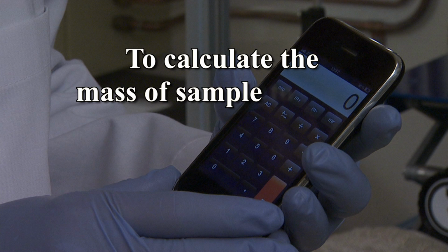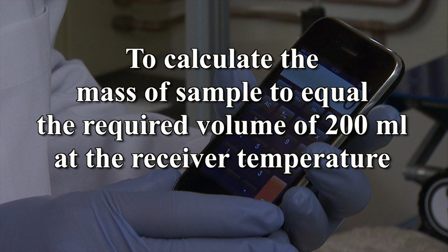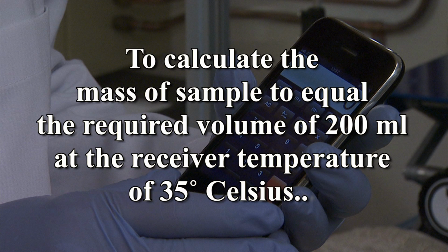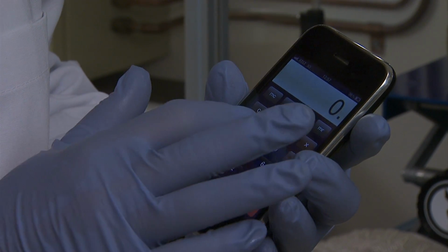To calculate the mass of sample to be weighed to equal the required volume of 200 milliliters at the receiver temperature of 35 degrees Celsius, multiply the measured specific gravity by 200.